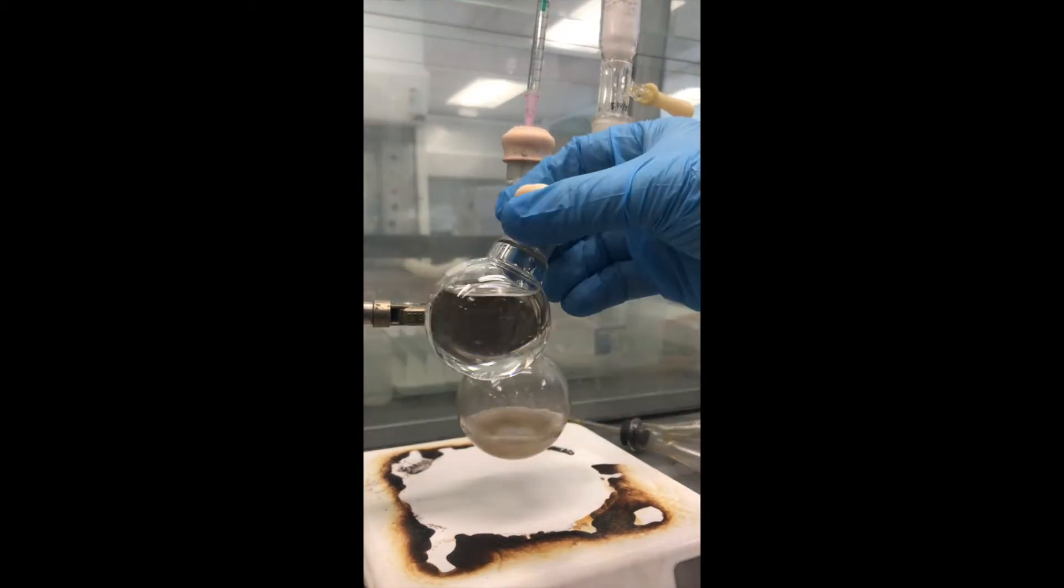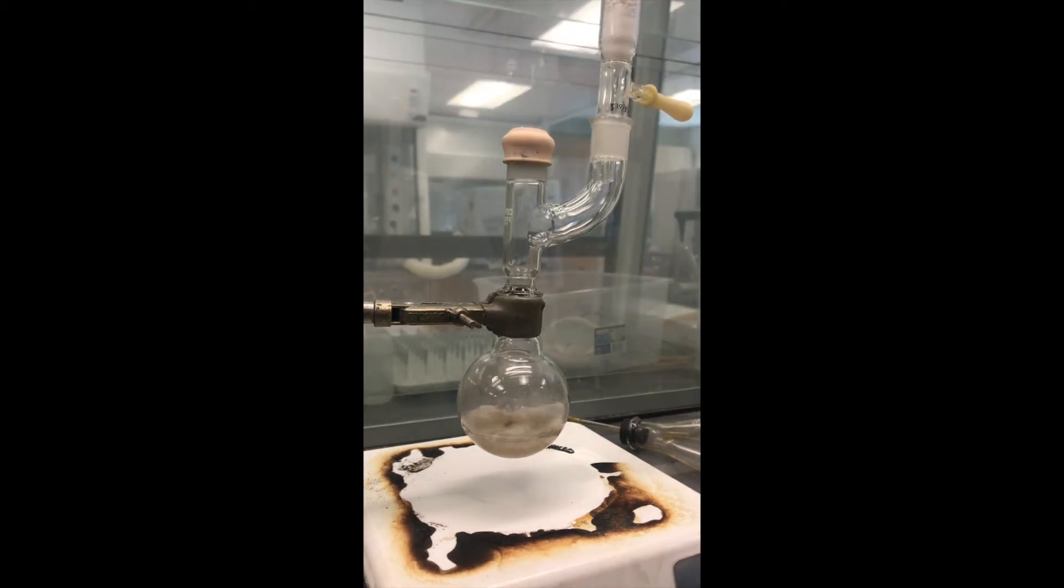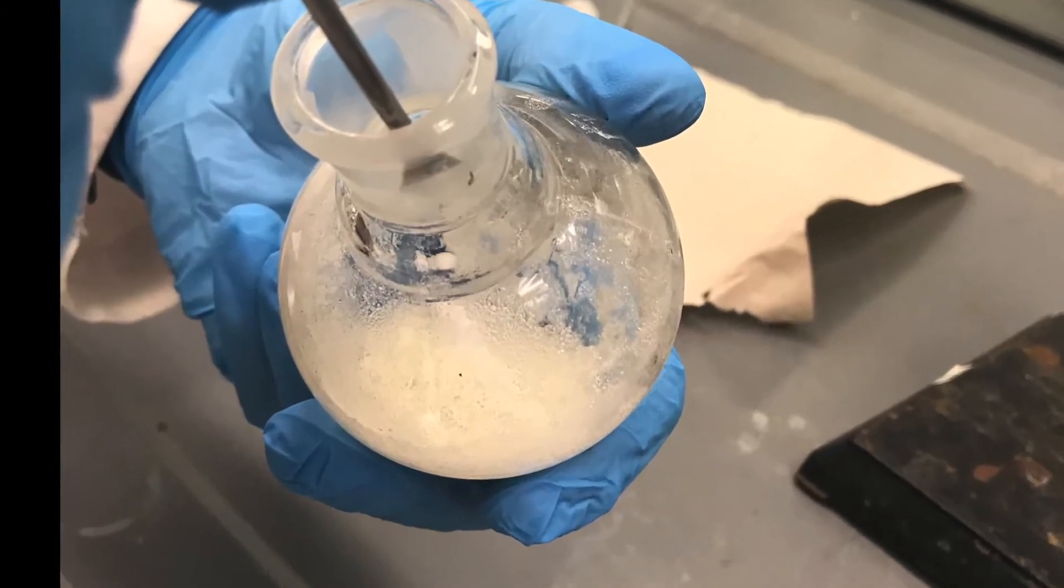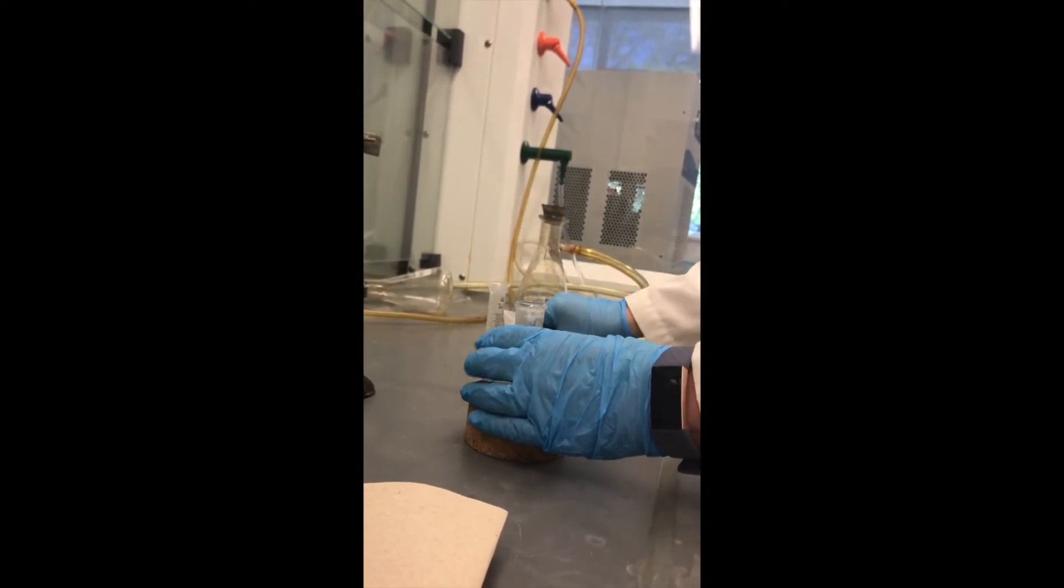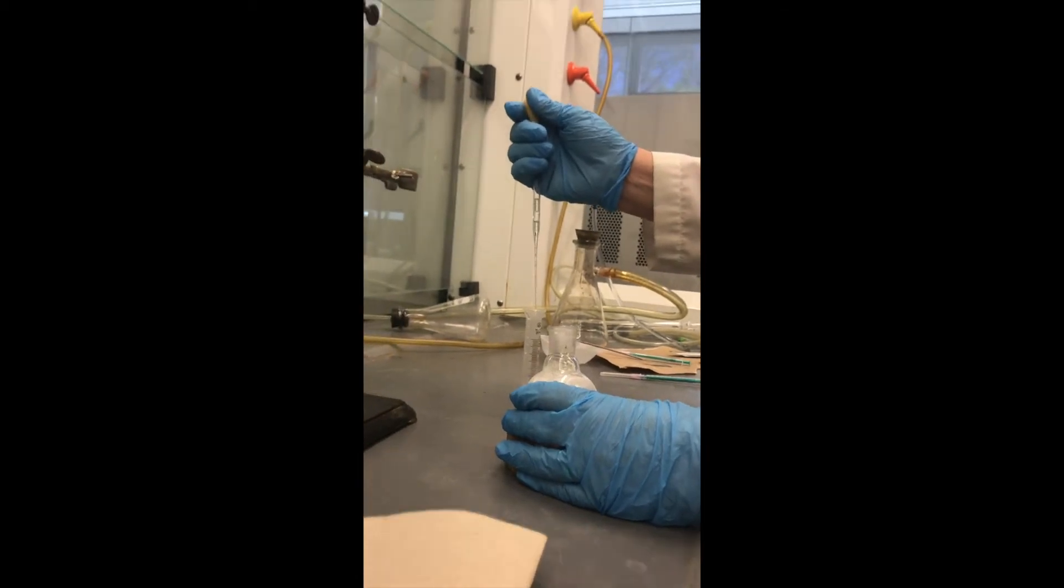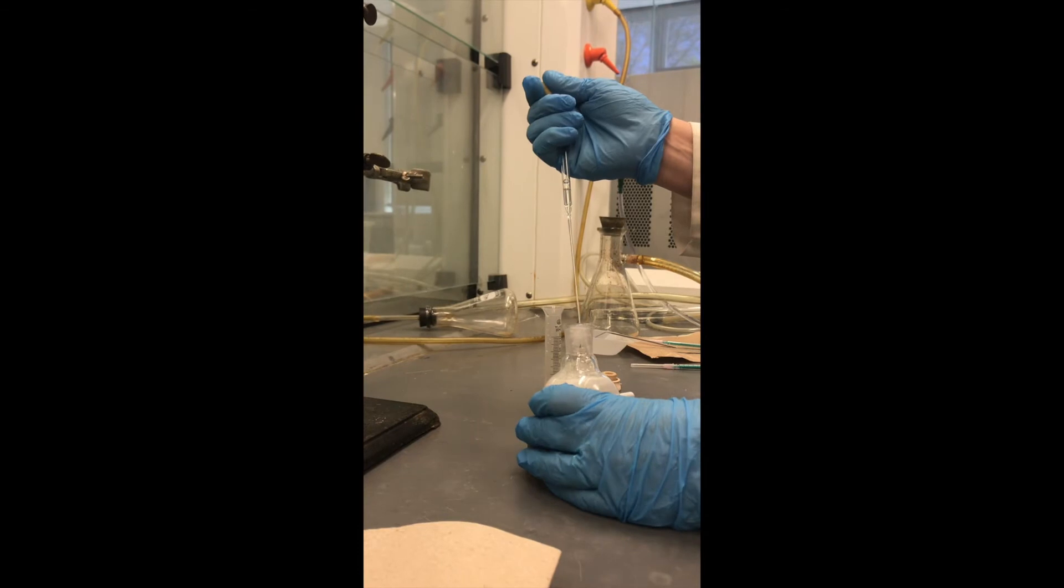Here I am adding the ether that I used to rinse out the vial. Here it is after 15 minutes. So, you are going to add the HCl to neutralize the reaction right here. The addition of the acid will convert our intermediate into our final product of triphenyl methanol.